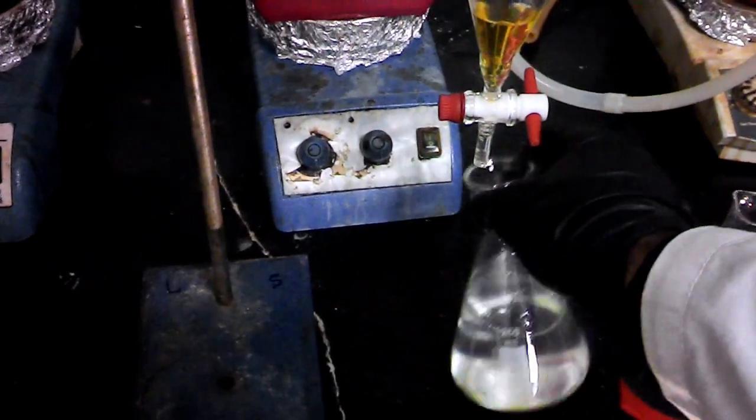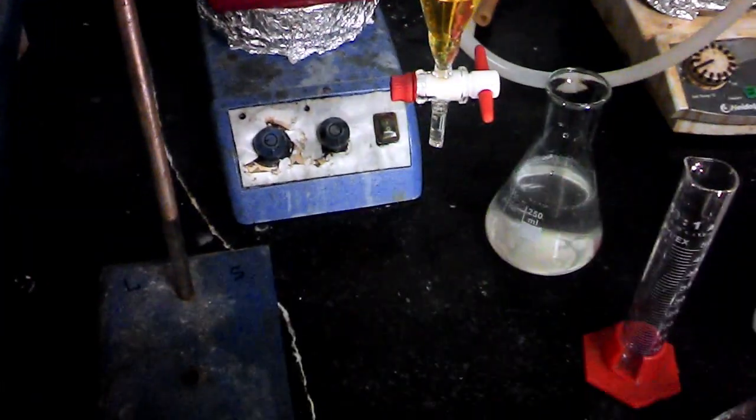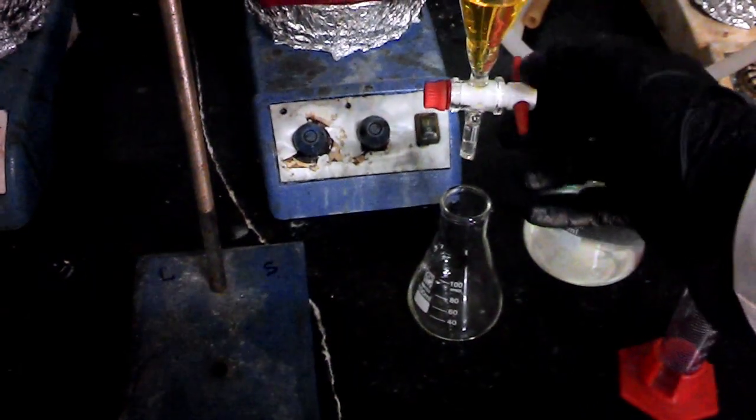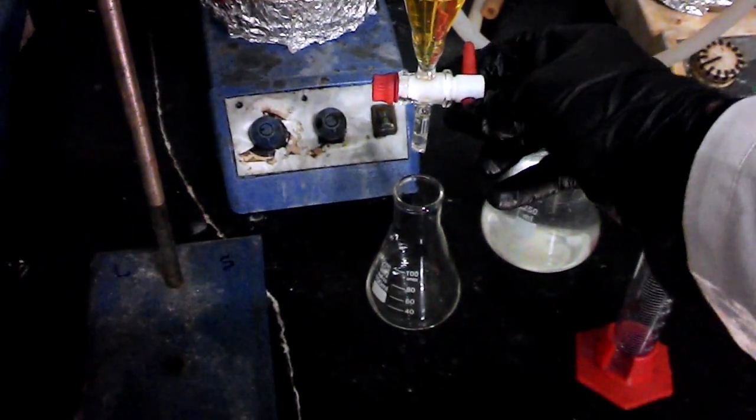Now it's time to change the Erlenmeyer flask. I'm using a little flask to save my product.